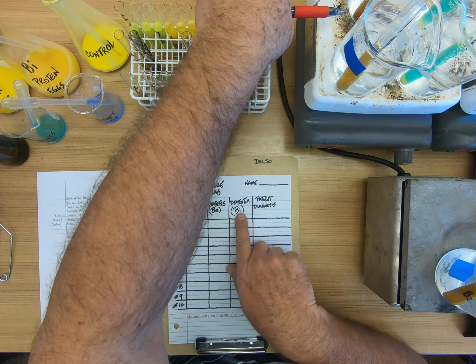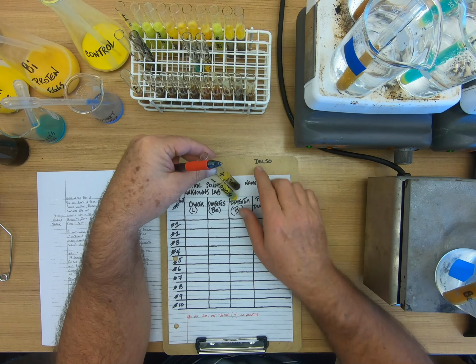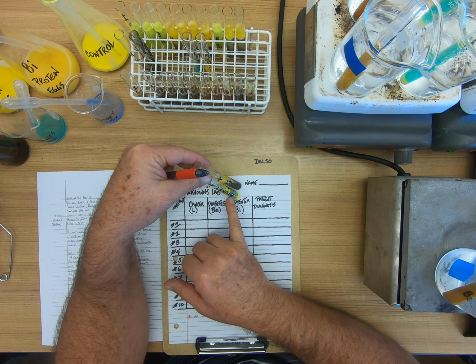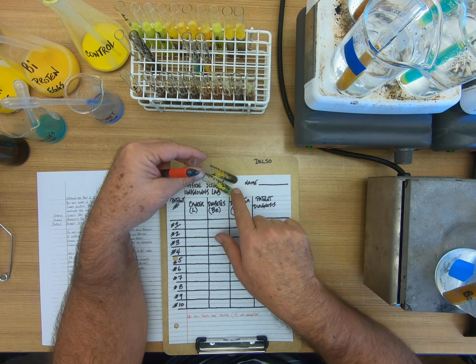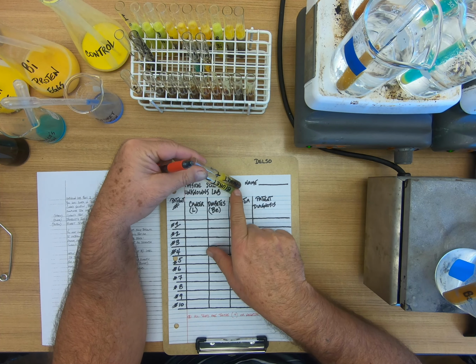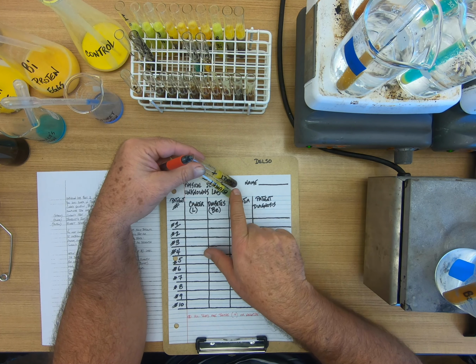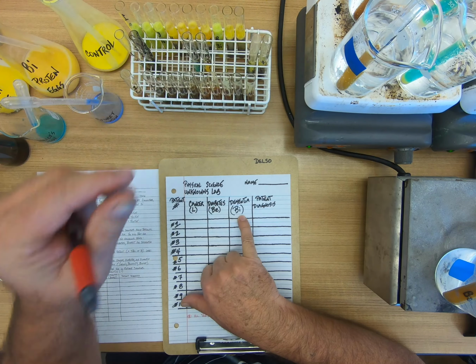And then the last one we're going to do is dementia. And this one we use Biuret. This is the negative test. It stays this light green, or the substance stays yellow. If it turns a dark color like this, that is a positive Biuret test for dementia. Okay? So here we go.